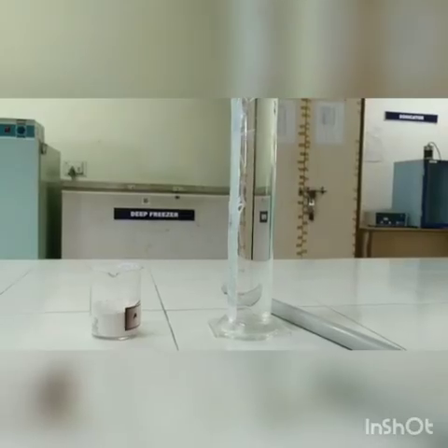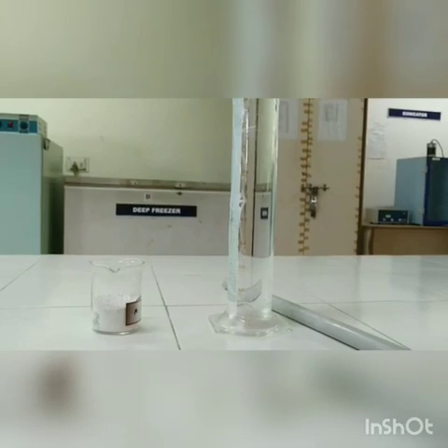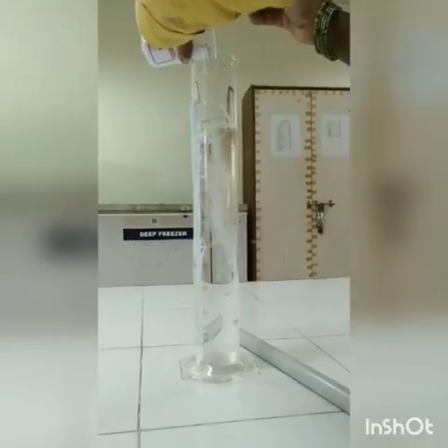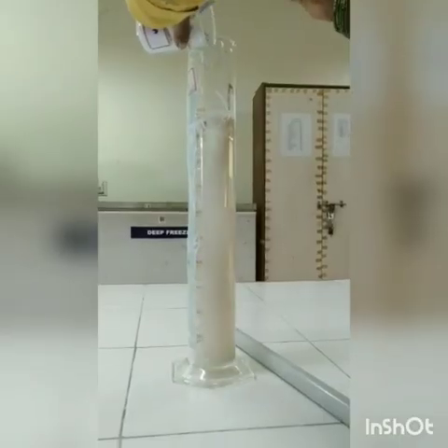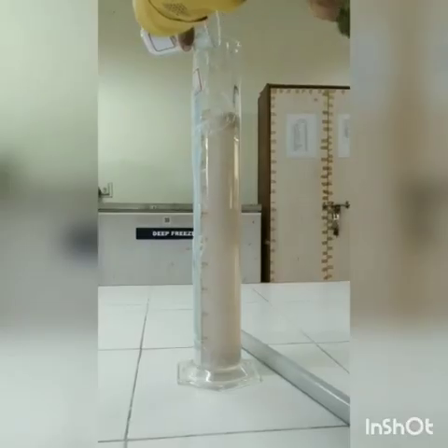To prepare a slurry, we are going to use the solvent. In this measuring cylinder, we are going to add a defined quantity of 50 gram of calcium carbonate lime into the water to have a homogeneous mixture. First, we need to add it to have a homogeneous mixture.